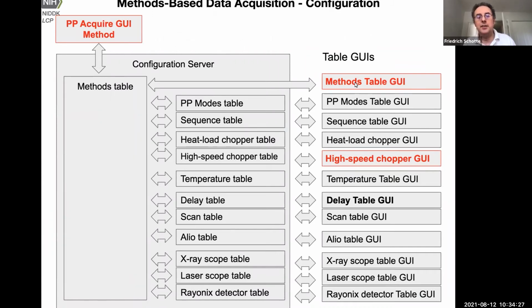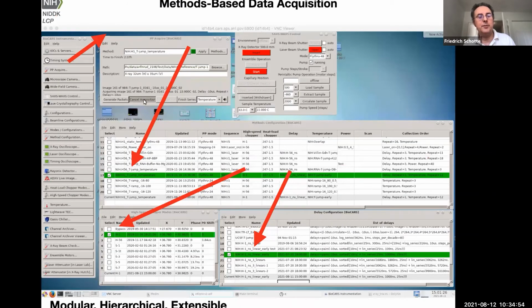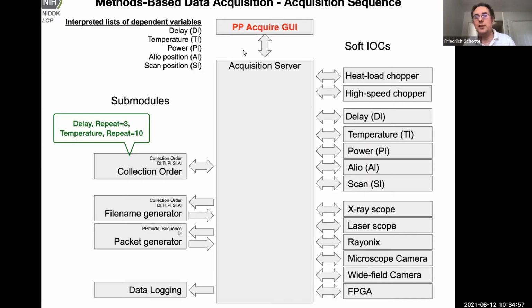And behind the application, there's an acquisition server that actually executes the data collection. It's separate from the GUI. It runs as a background process and communicates with the other components via EPICS using process variables and channel access. So see this GUI here. When you press, say, collect data, it sends a command to the acquisition server that's instructed to do its job.